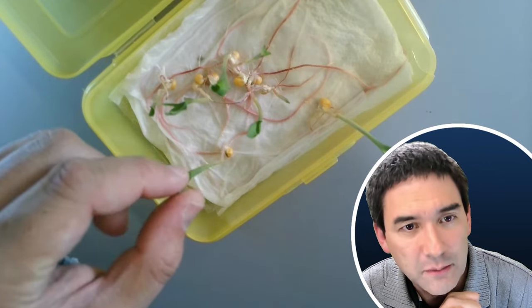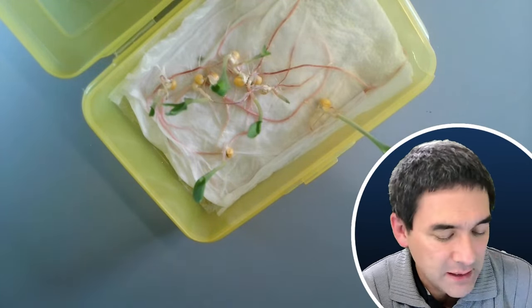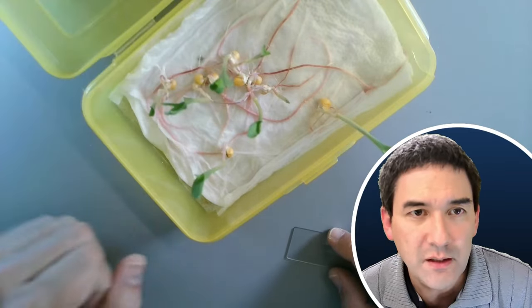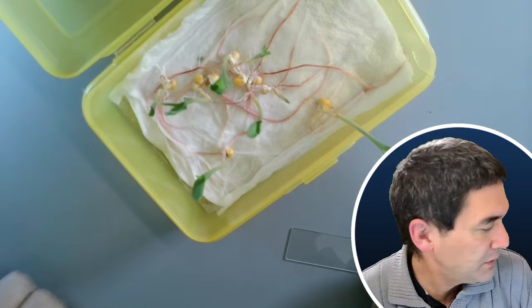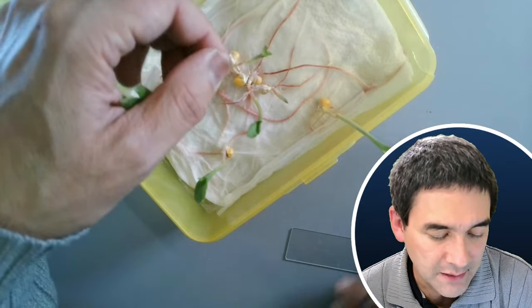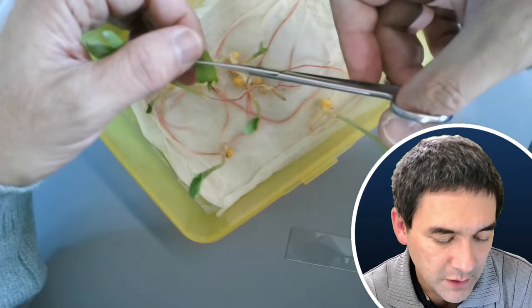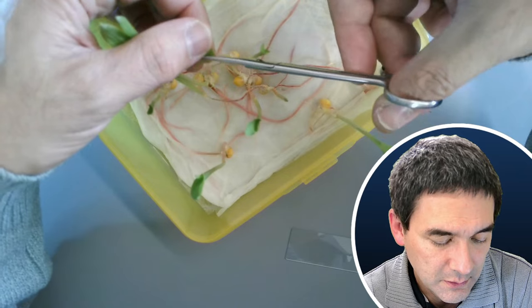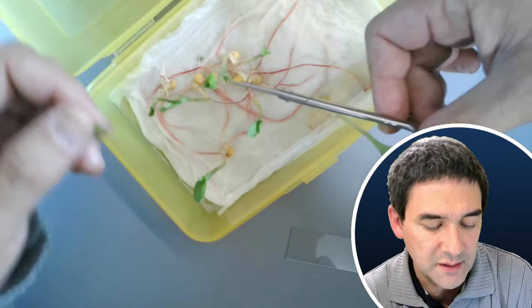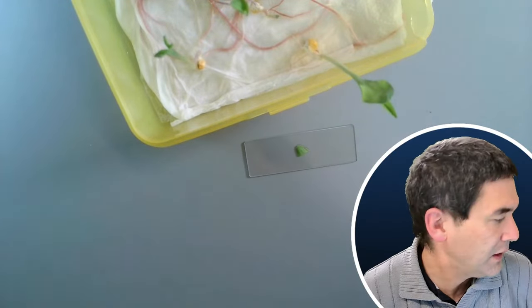First, before looking at the root tips, I just want to take one of those leaves and put it under the microscope. I don't have very high expectations because those leaves are pretty thick — multiple cell layers thick. But because I'll be throwing this leaf away anyway, and a new leaf is growing from the apical meristem down there, I can easily cut part of it off and the plant will continue to grow.